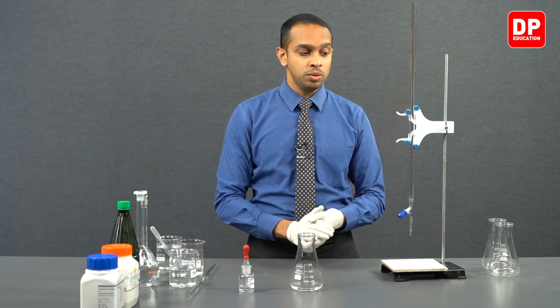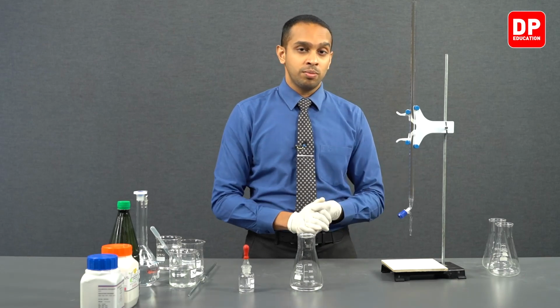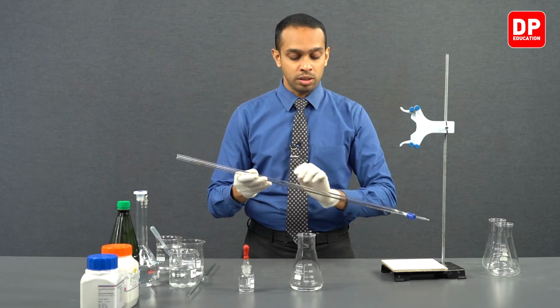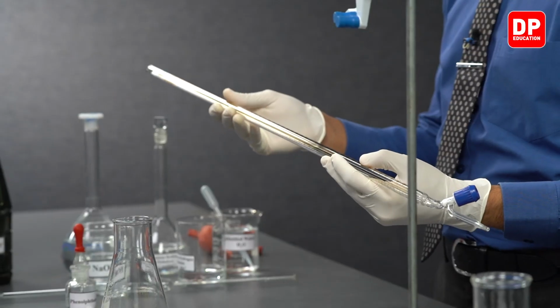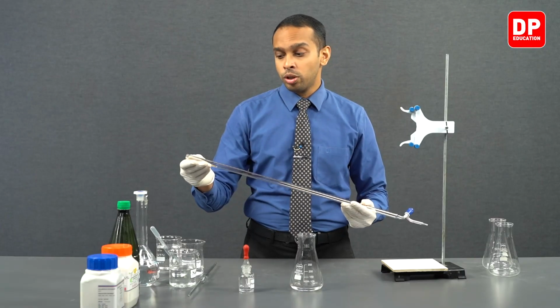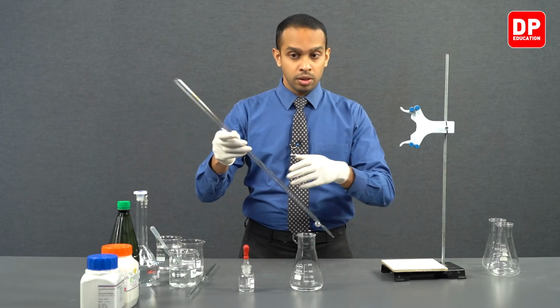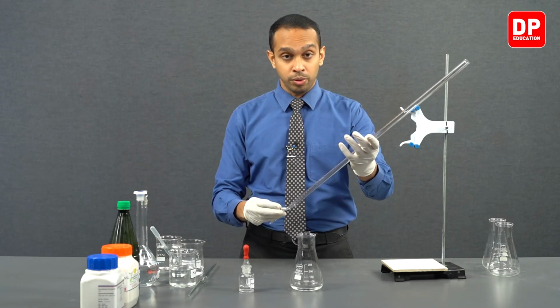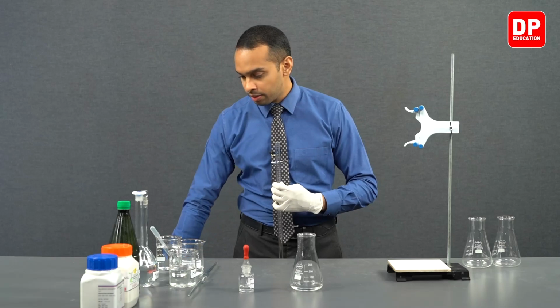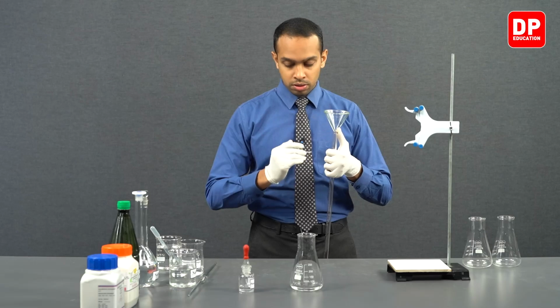Now we can proceed to taking our sodium hydroxide into our burette here. We have a burette here which is already washed with distilled water. We can proceed to wash it with sodium hydroxide, and then we can fill it all the way to the top and proceed to carry out our titration. So before starting to wash your burette, make sure the burette is tightly closed. Then we can proceed to add a small amount of sodium hydroxide to our burette here.